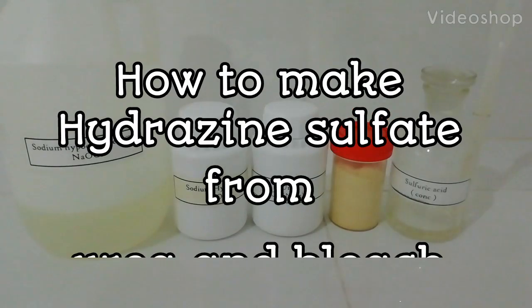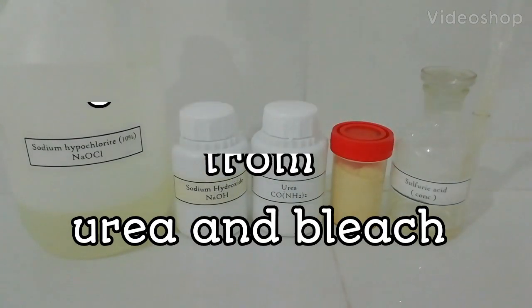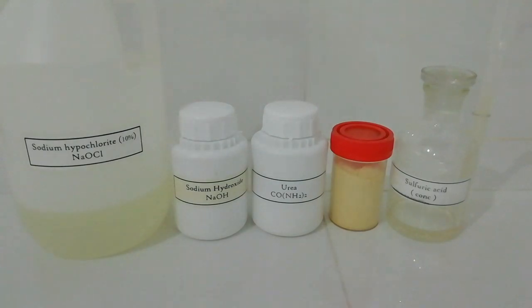This video shows how to make hydrazine sulfate using sodium hypochlorite and urea. In a previous video, hydrazine sulfate was prepared using sodium hypochlorite and ammonia.